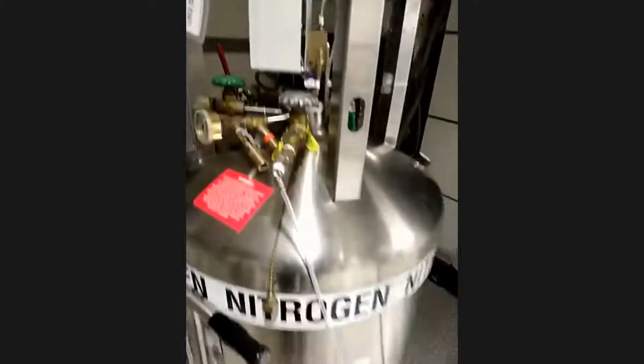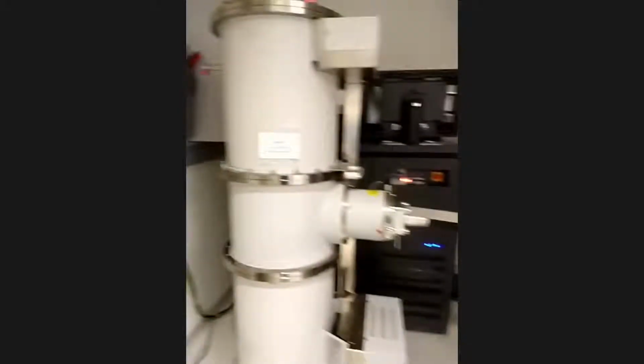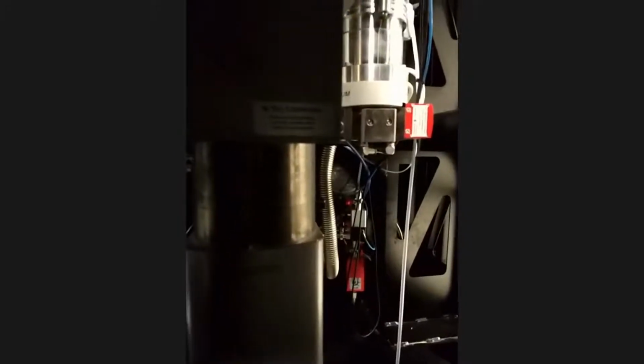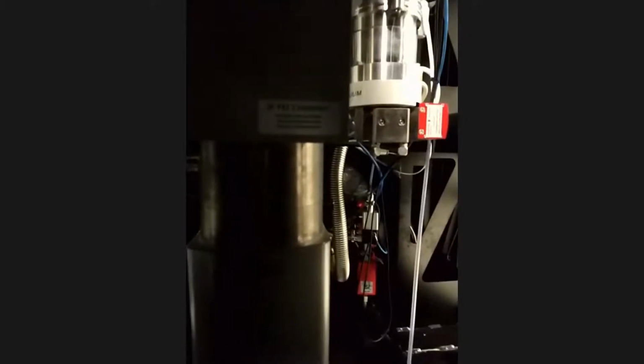And the microscope is automatically cooled by the cryogen, as Adam talked about. This is liquid nitrogen. And this is the 300,000 volts of electricity applied to the tip of the electron source. As you can also see, we have a monochromator here that's trying to pass the electron through and remove whatever color of electron, quote unquote color, that you don't really want.